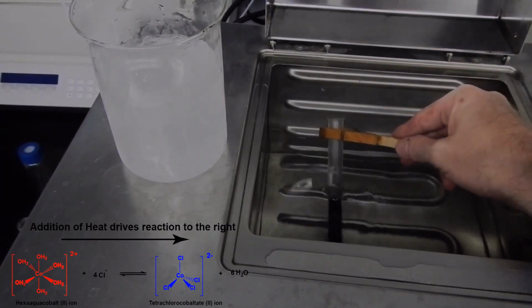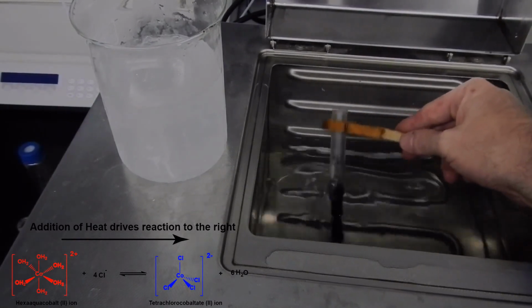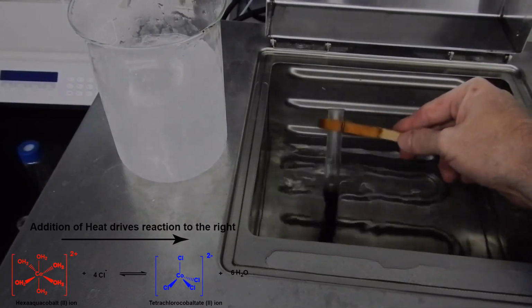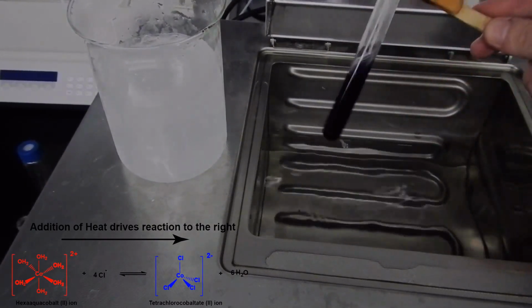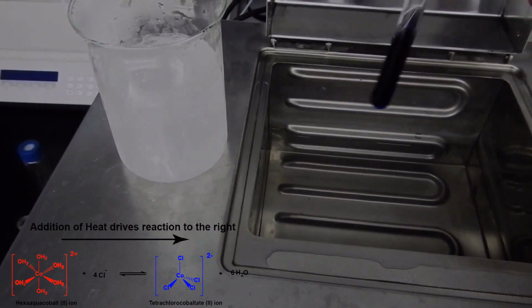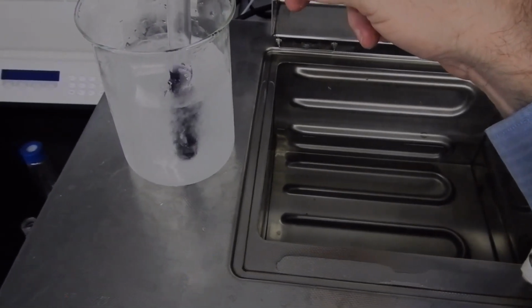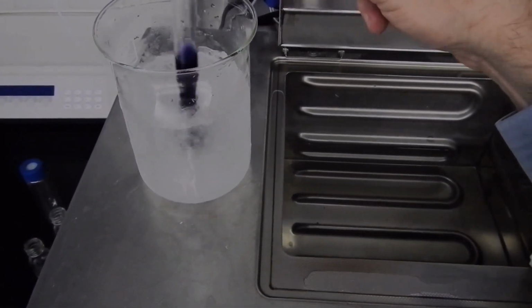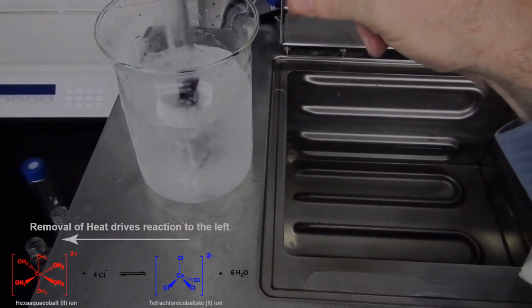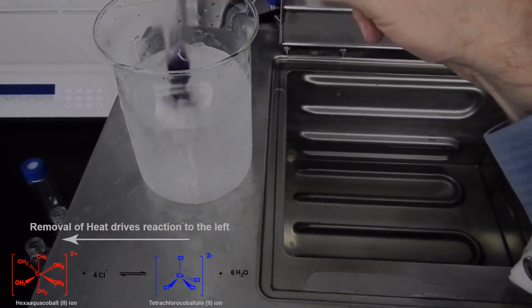Here we are, here's the blue color, almost. Here's our endpoint, which is our blue complex, which is our tetrachlorocobaltate ion. Now we can change that back to our hexaaqua complex just by cooling the solution, and I'm just dunking it here into ice water. Ice water is of course at 0 degrees Celsius.